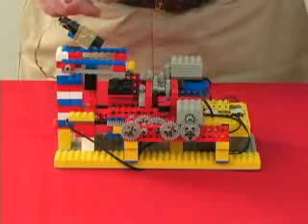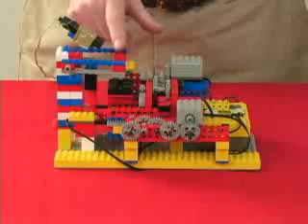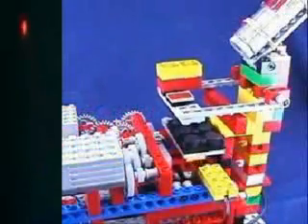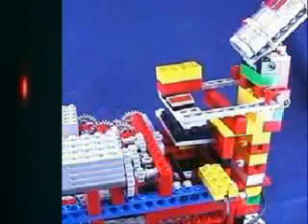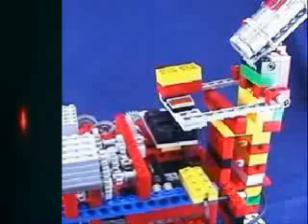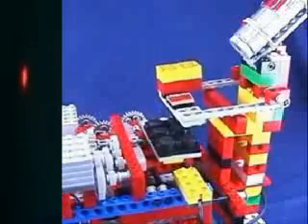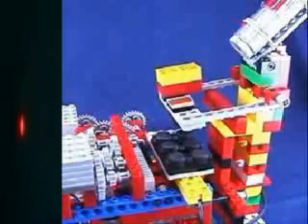The laser beam, once it bounces off the reflective surface, goes to a detector some distance away, and that exaggerated motion shown on the detector is picking up the very subtle motions of the cantilever probe.